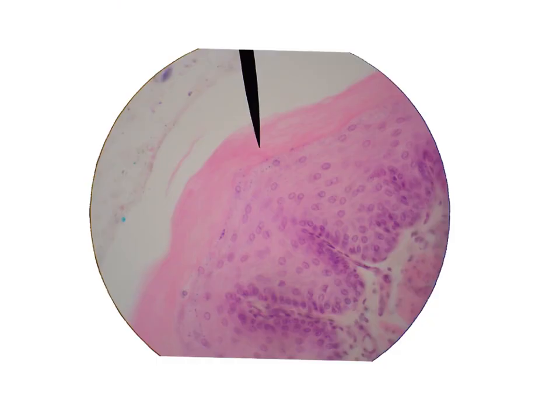Again, it is a keratinized stratified squamous epithelium. This is the keratin, the flat superficial nuclei, the many layers of nuclei, so it is stratified, and it is stratified squamous, and it is covered with keratin. And it is written in the exam as a keratinized stratified squamous epithelium.